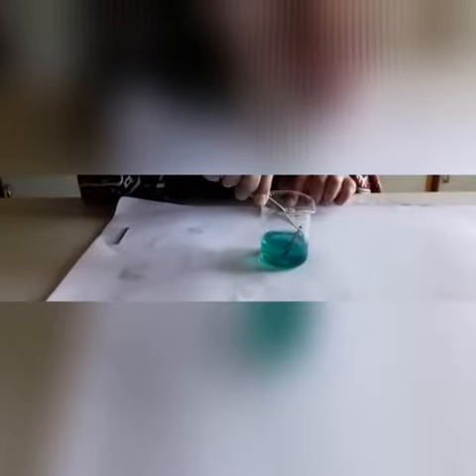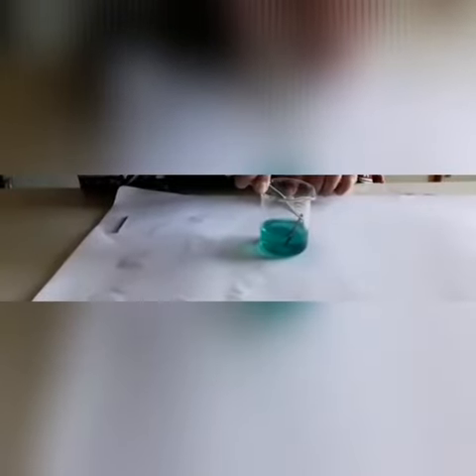We perform this experiment with copper sulphate. This is copper sulphate solution. Now I put an iron nail in it. What happens is that iron will dissolve in the solution and displace copper, and copper will deposit on the iron nail.